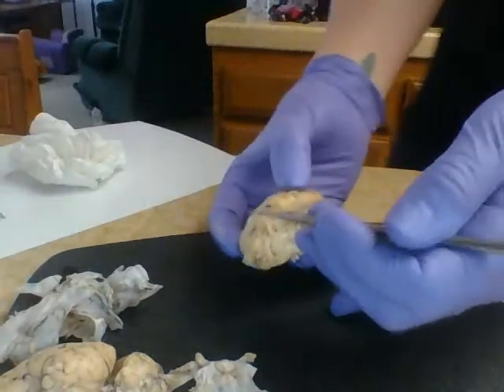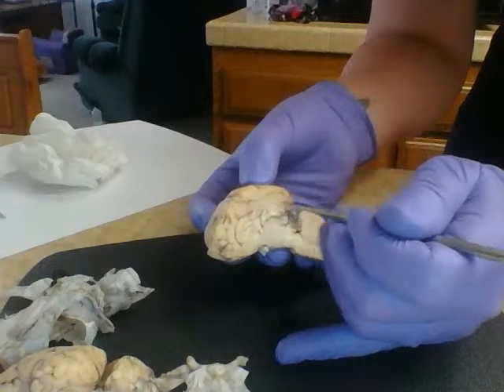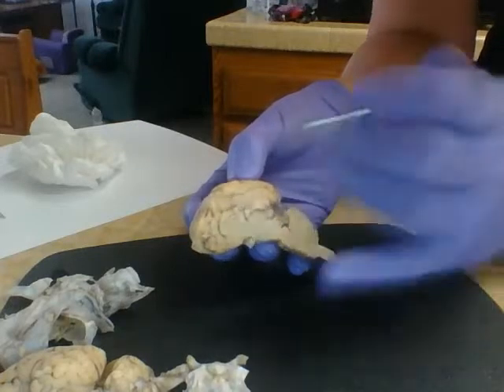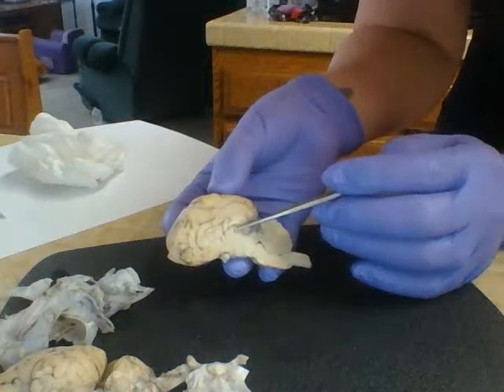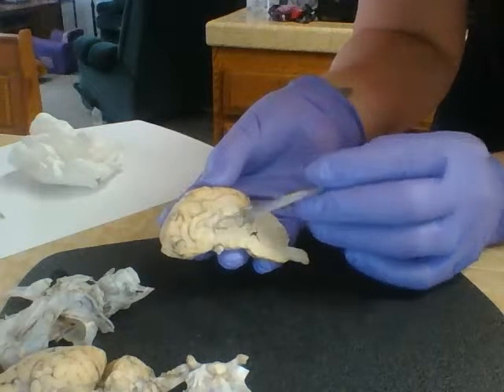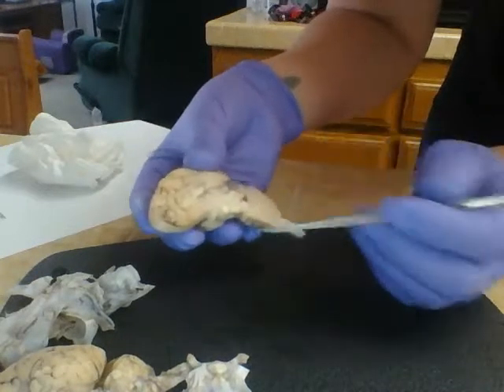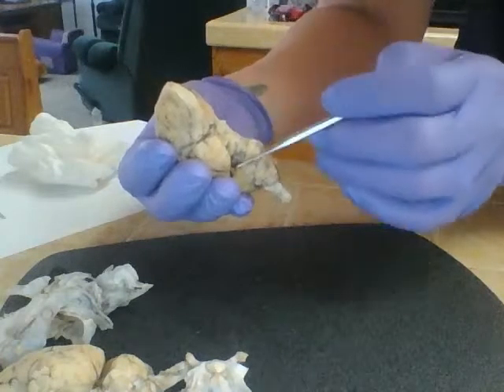The lateral ventricles. Ventricles run through certain portions of the brain, so the lateral ventricle actually runs up through the middle of the cerebrum. So it's going to be a little bit hard to point out and see. Then we have the intermediate mass of the thalamus. So our thalamus sits right up in here. Takes this kind of big area here. Again, that cerebral peduncle, we can see a little bit better now. Is that kind of forked area as it kind of branches down. You can see it sitting there.